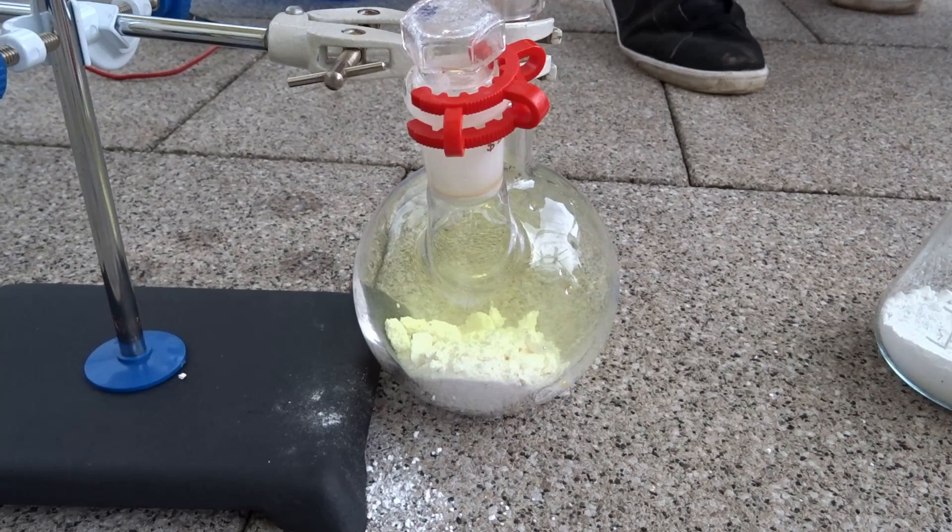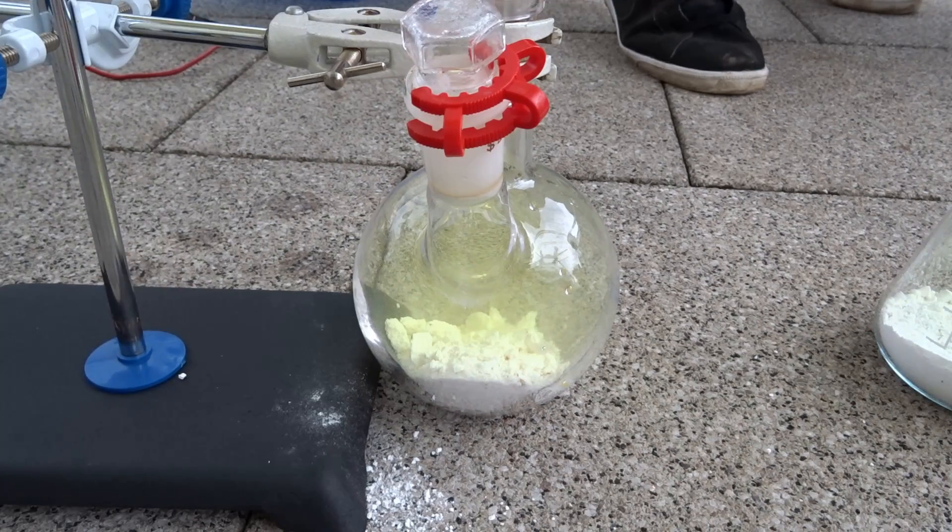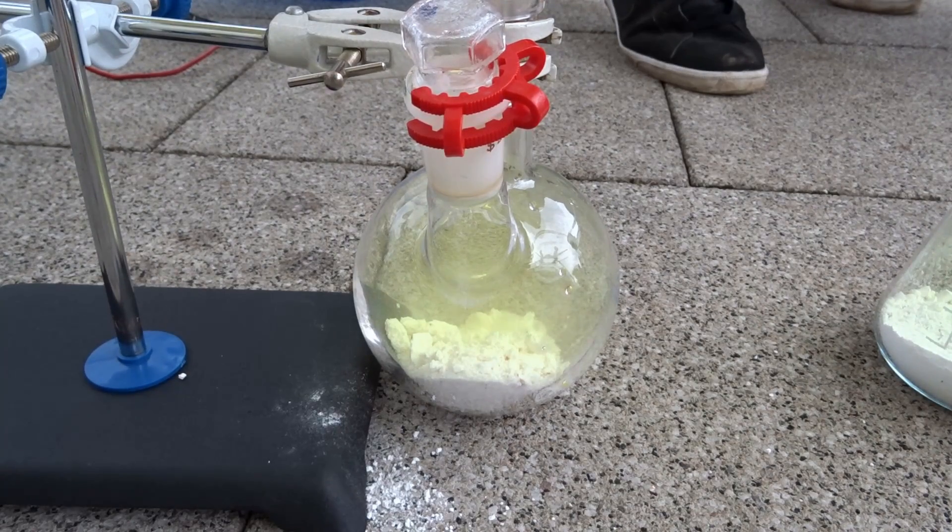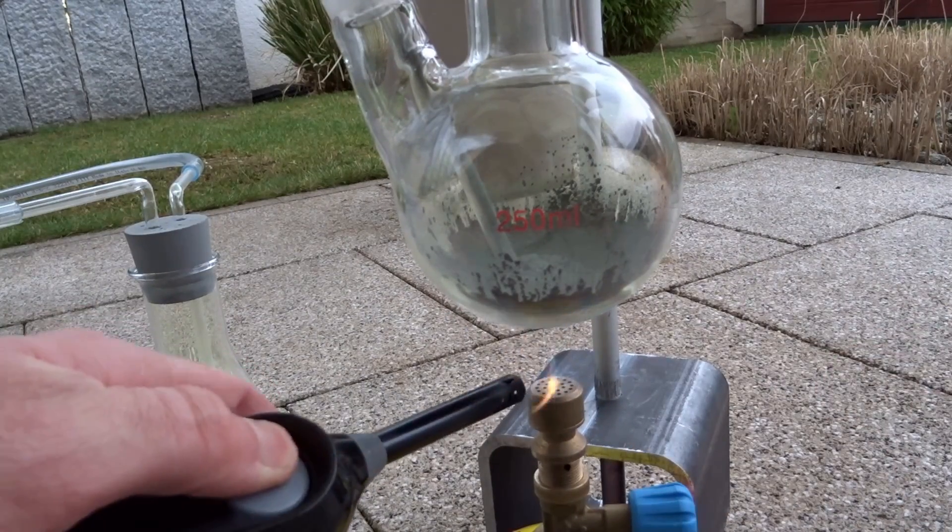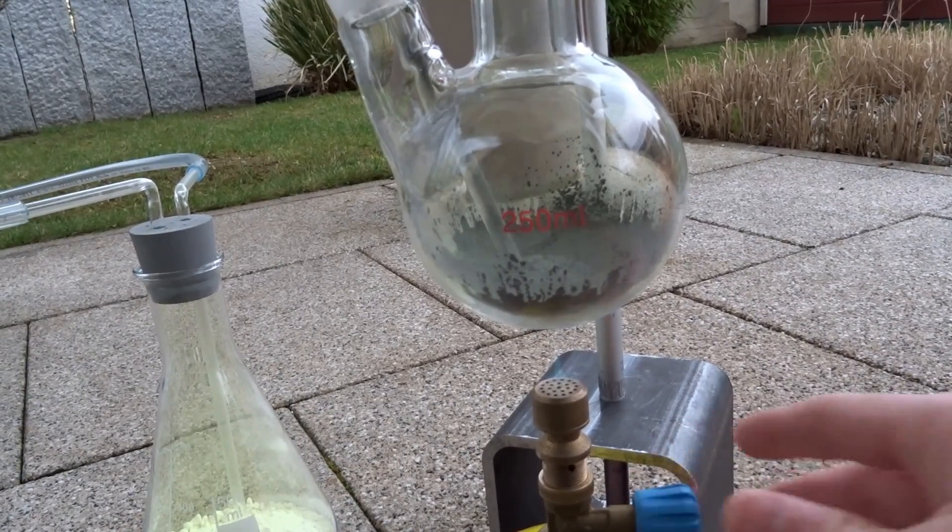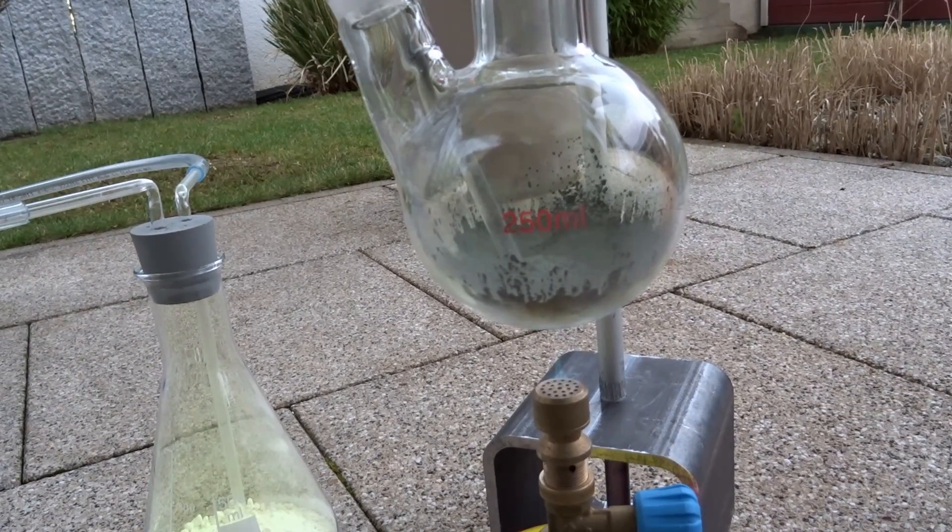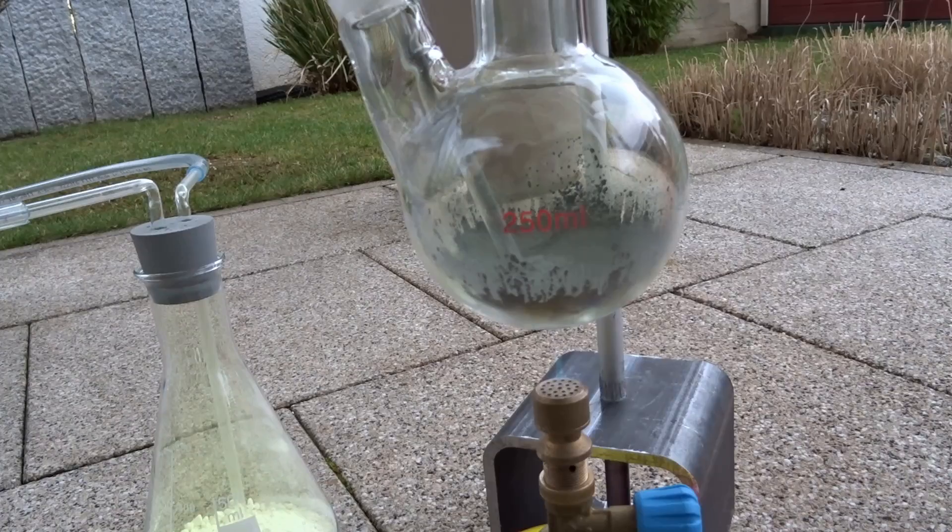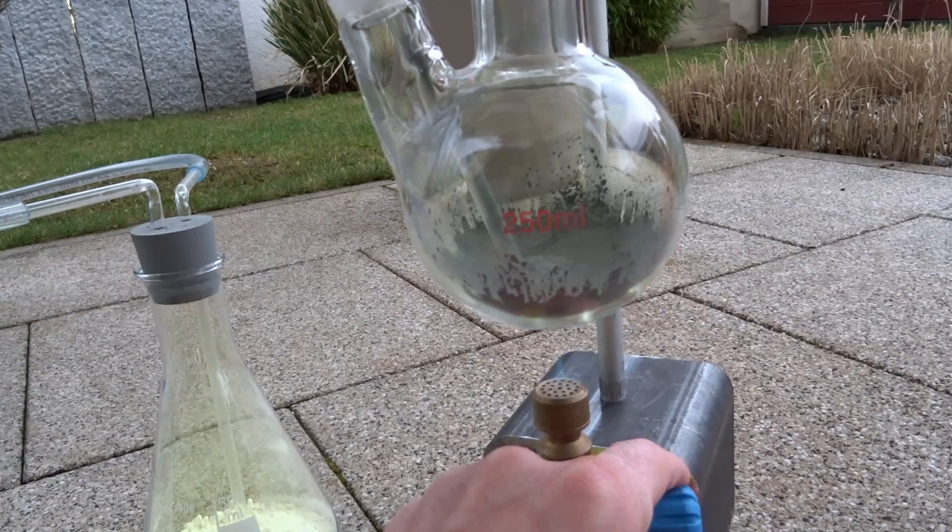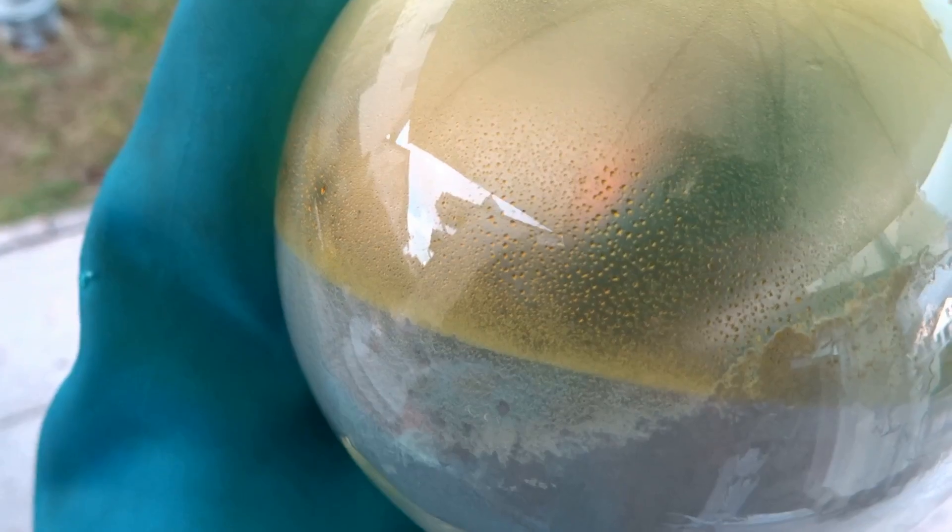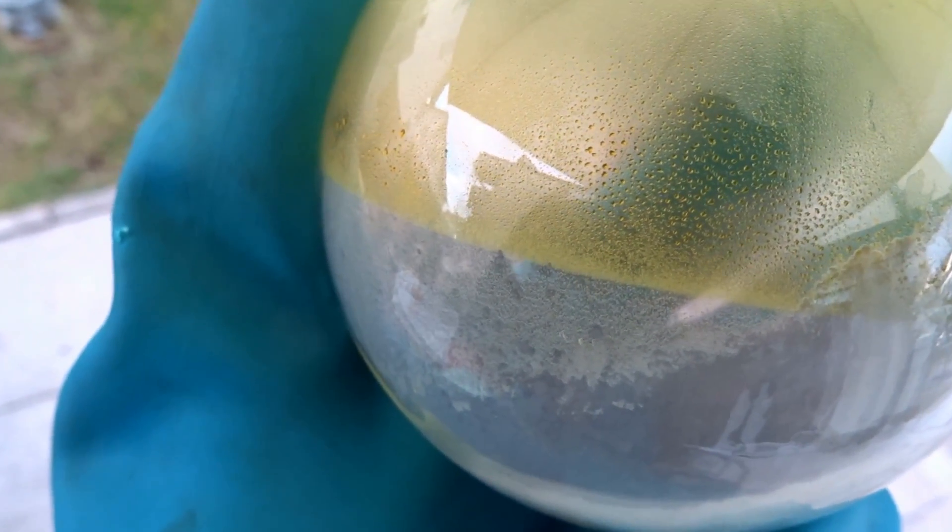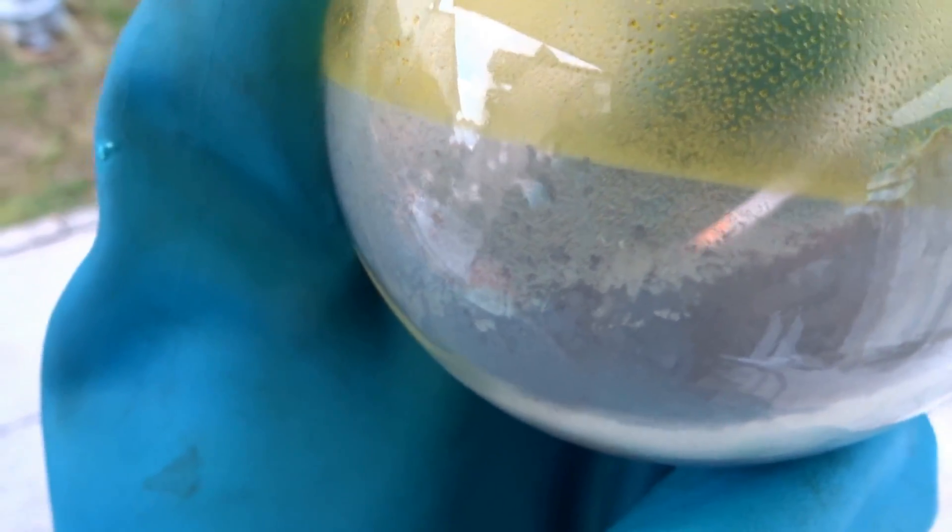And I really tried to oxidize the silicon carbide with the chlorine under heat, but probably the heat was just too low, although I put the burner hotter and hotter and I had a chlorine leak, which is always not that funny to happen next to you. But I'm pretty glad I don't have to deal with this TEOS and silicon tetrachloride anymore, because it's really annoying.